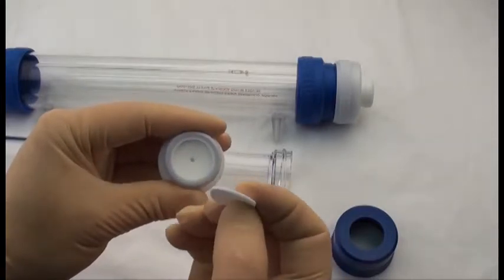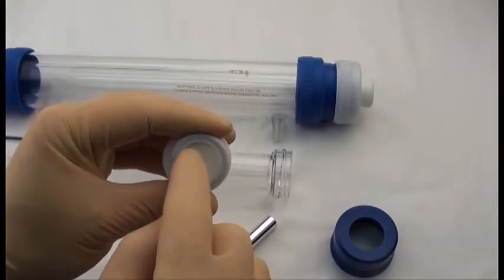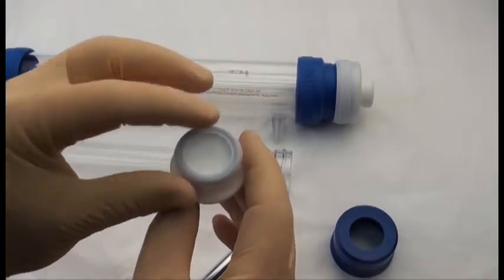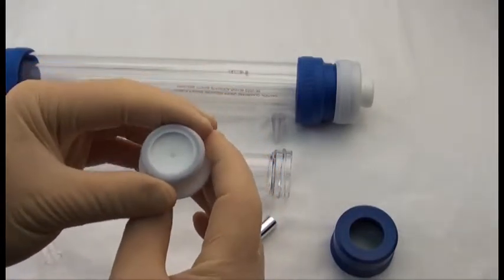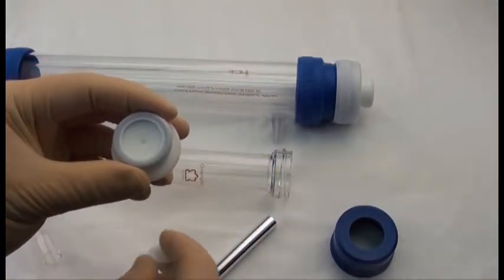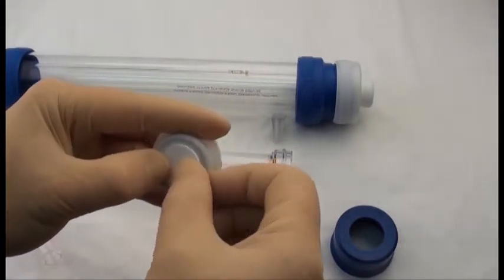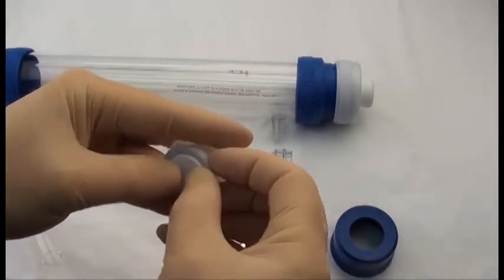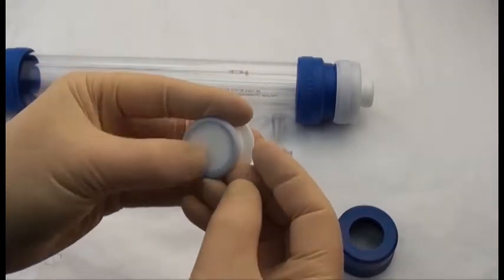So beneath the bed support there is another support. It's a PTFE mesh, and that stays in place. So when you get a replacement bed support, it just pops right back into the end fitting, just like that.